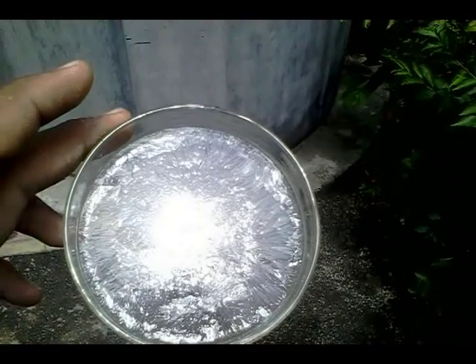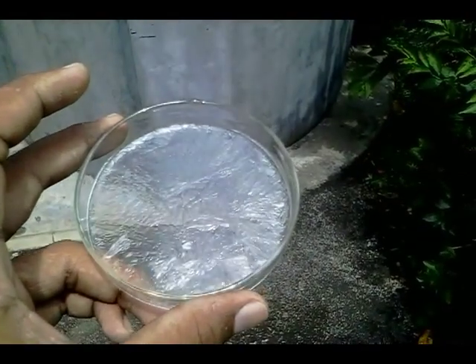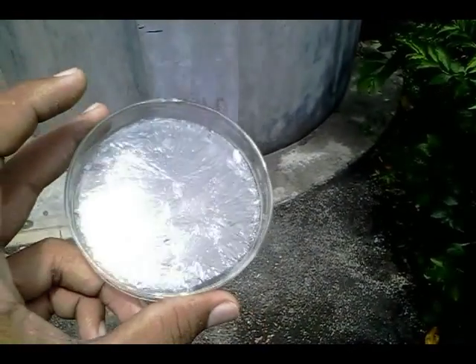Now you can see oxalic acid crystals. Wash the oxalic acid crystals and dry them.